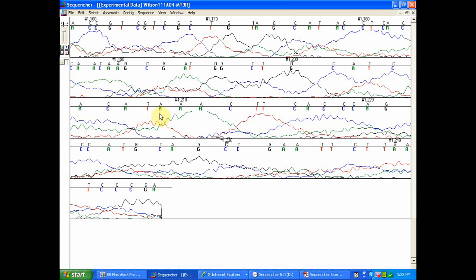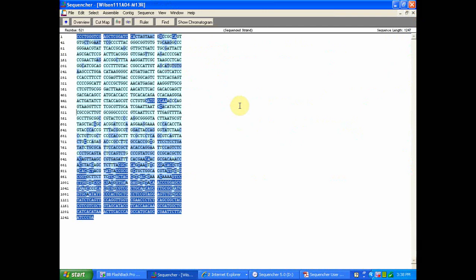We see a loss of resolution, no clear spacing, and it's very hard to read. This is data that we're going to go ahead and remove during trimming. The reason for this is so that you can identify anomalies within good sequence data and correct base calling error.